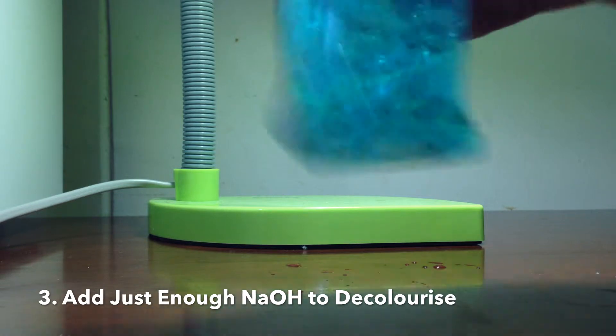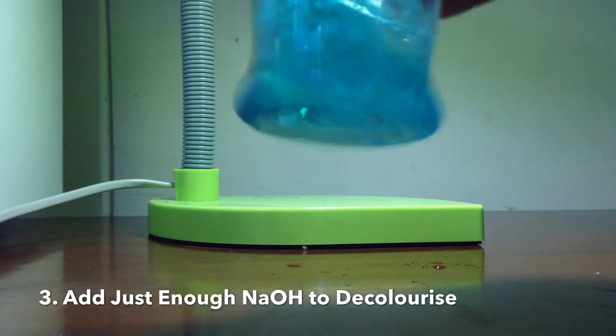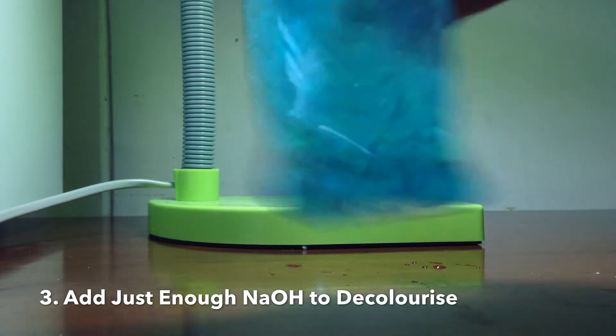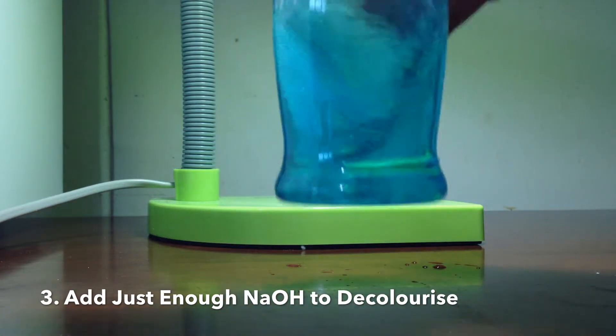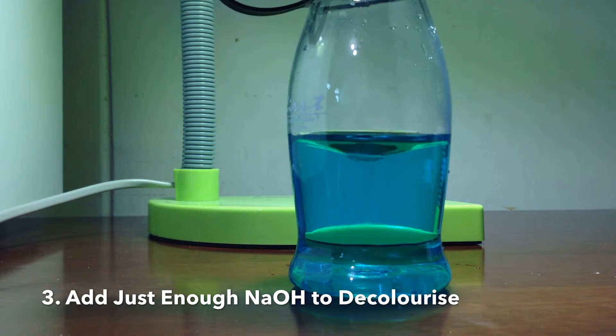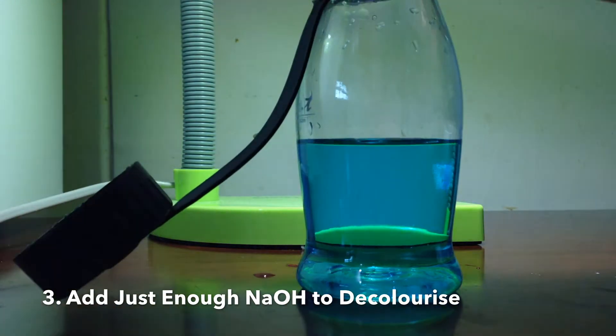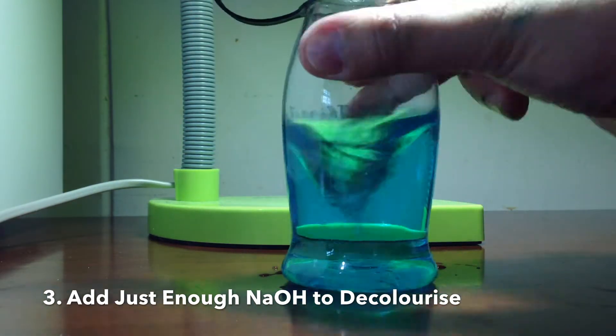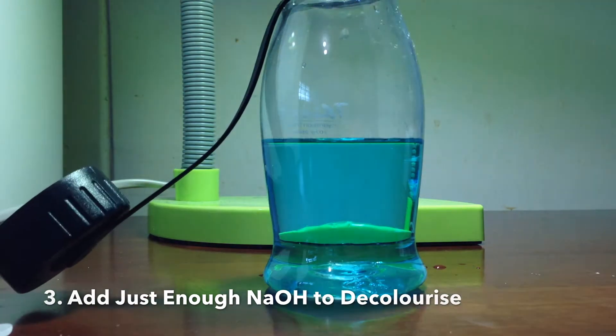Ensure each pellet is dissolved completely before adding the next one. Repeat this process of adding and swirling until the blue color disappears.